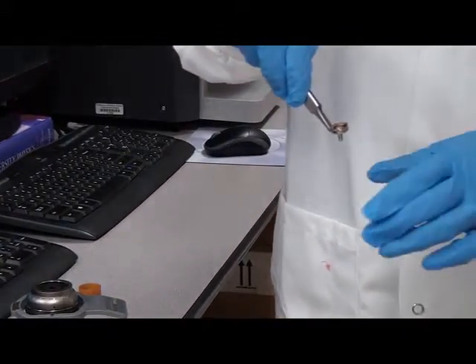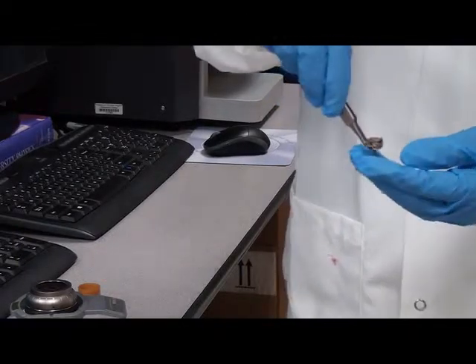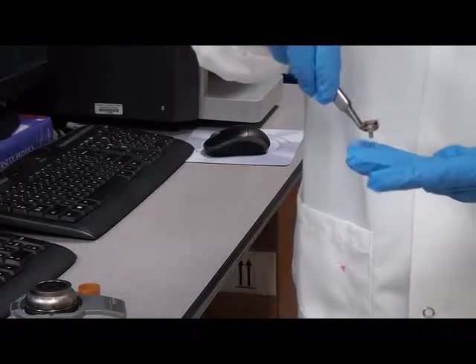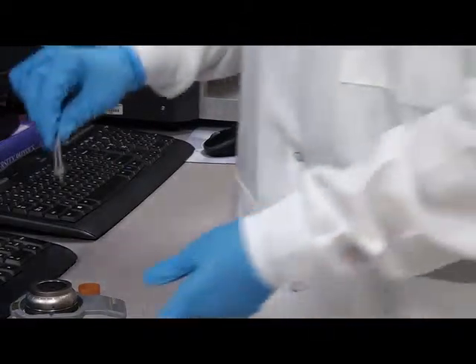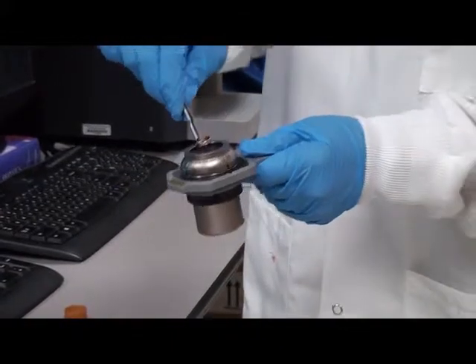The coating could be anywhere between 5 to 50 nanometers — a very thin coat. That gives us very good topographic resolution and magnification of the specimen that we are looking at. This is our sample holder and now we mount it.